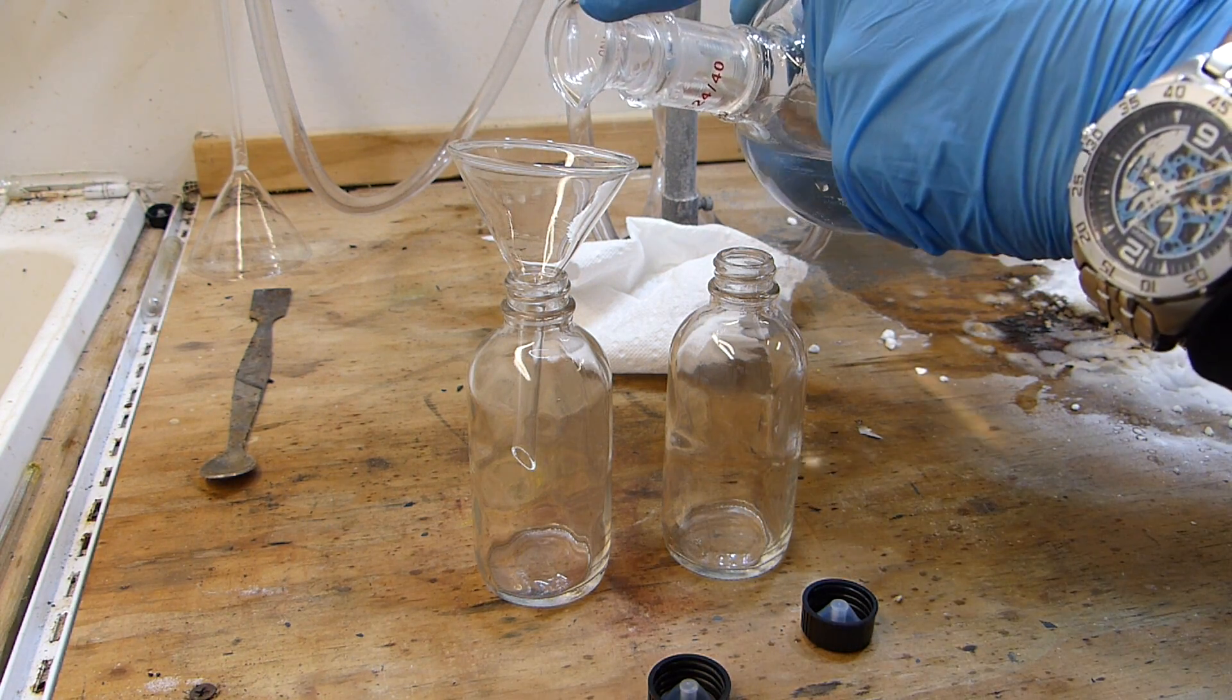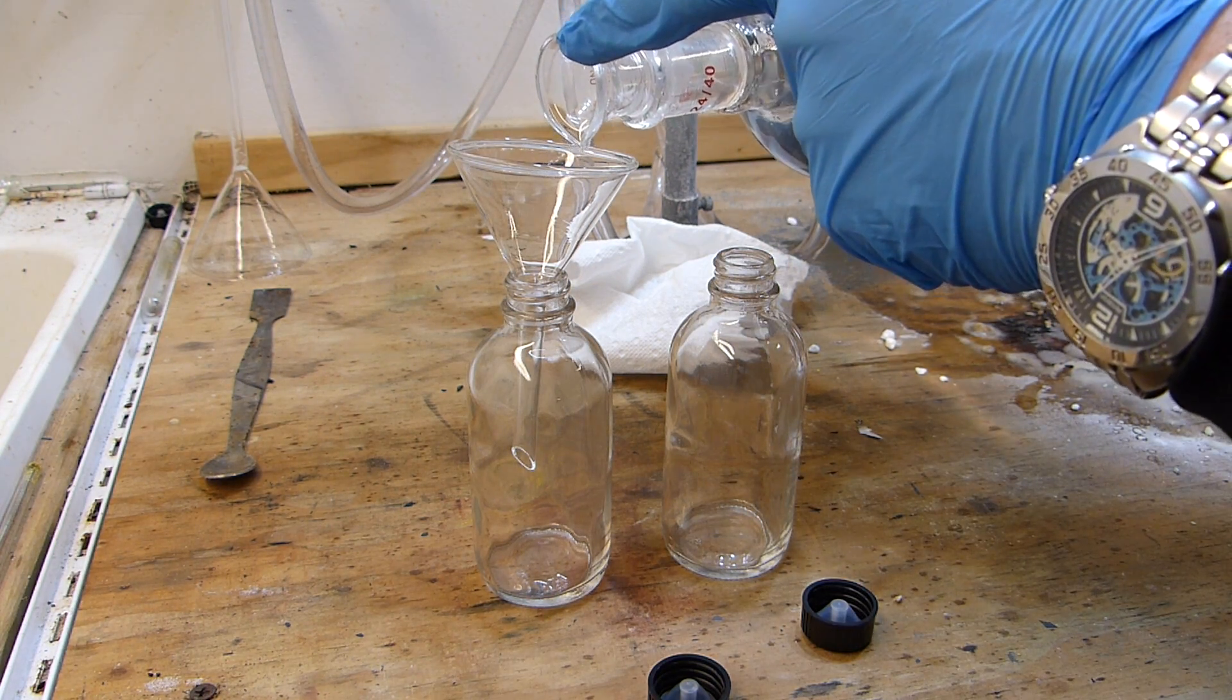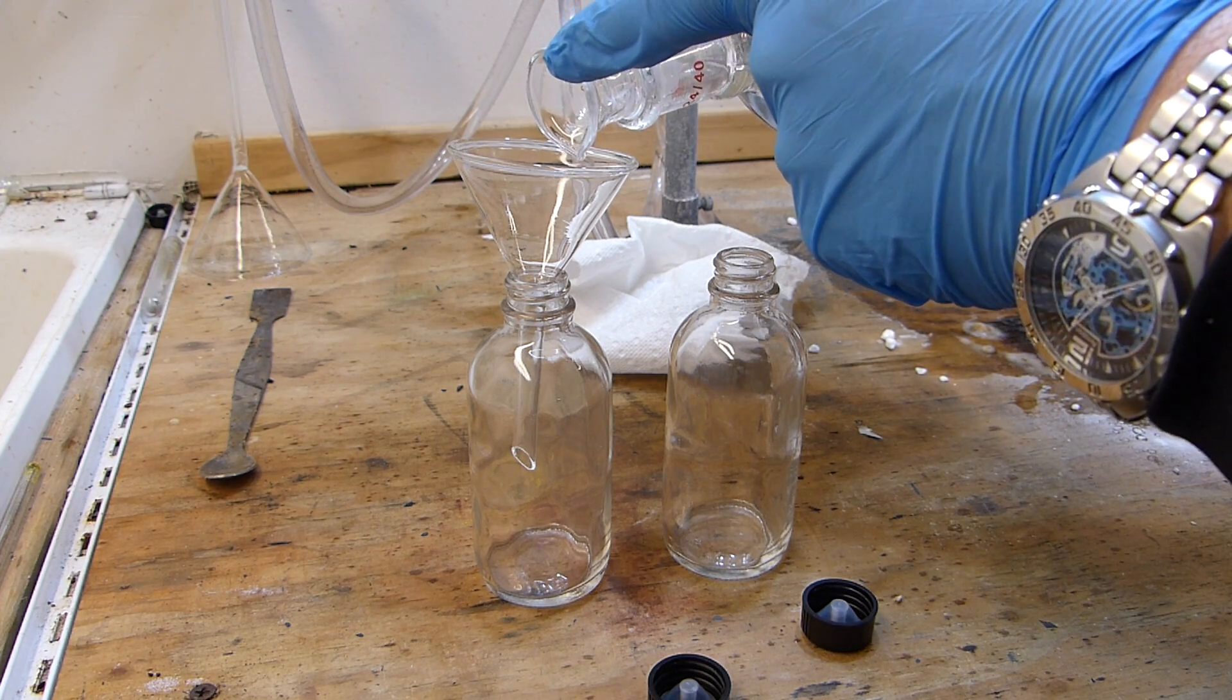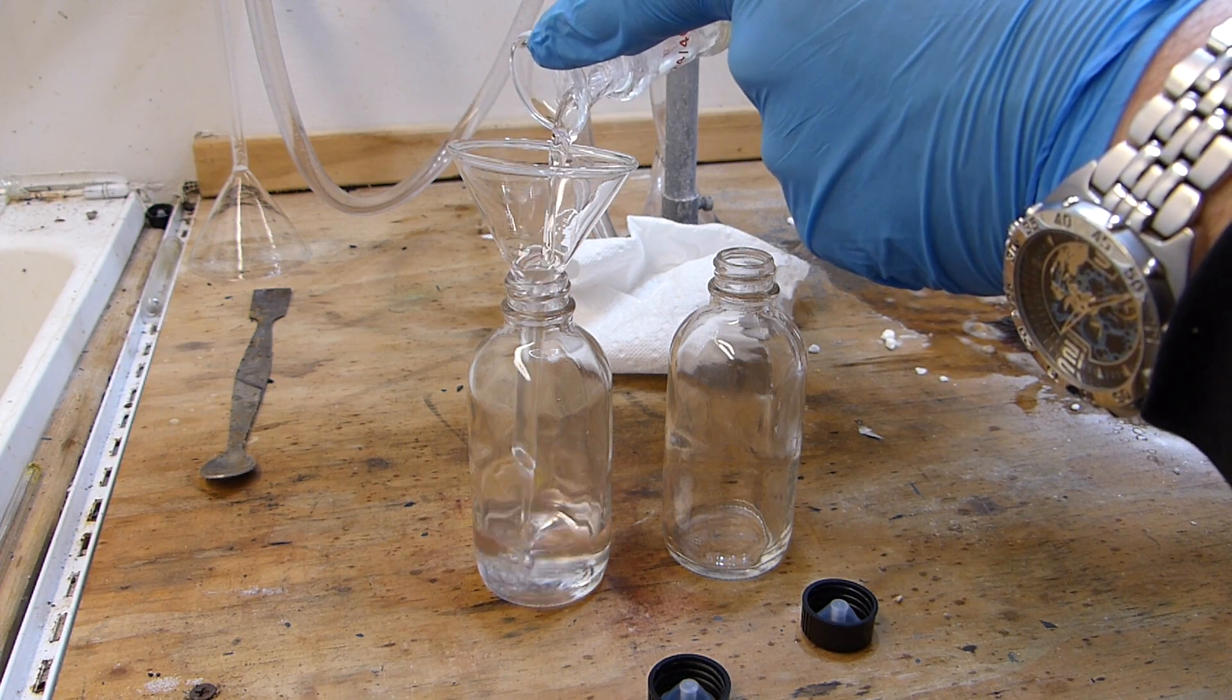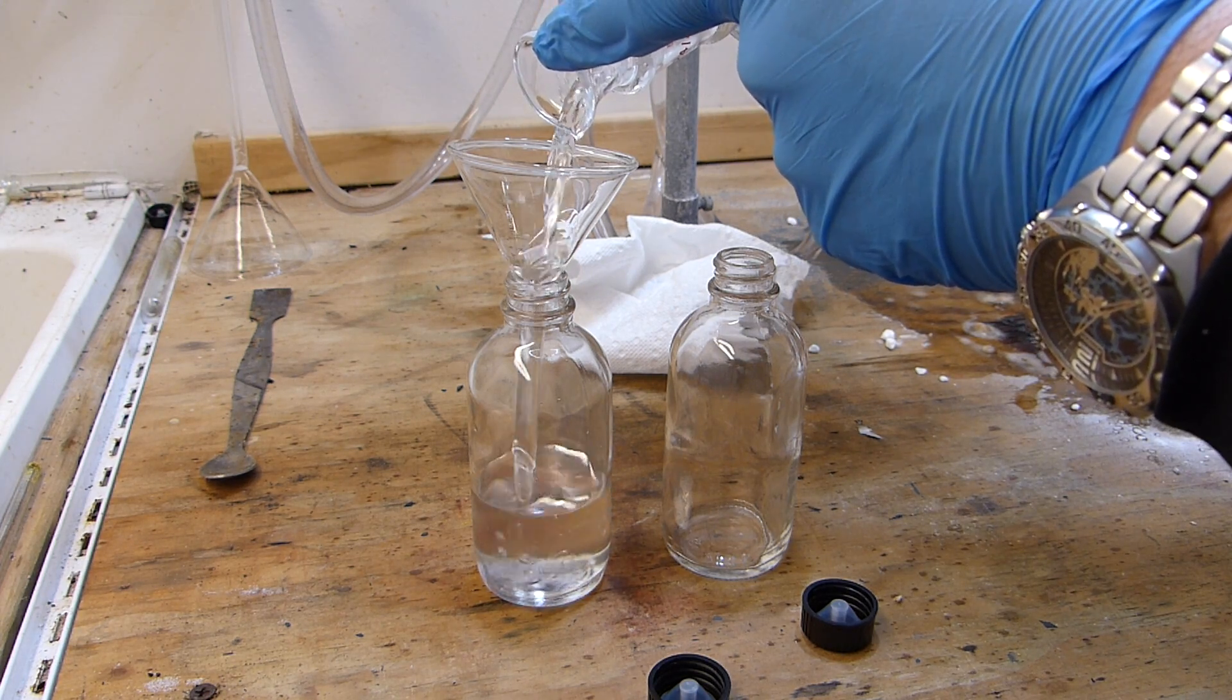And this is the finished acid going into its storage container, and you can see it's now a completely colorless syrupy liquid comprising of 98% very clean sulfuric acid.